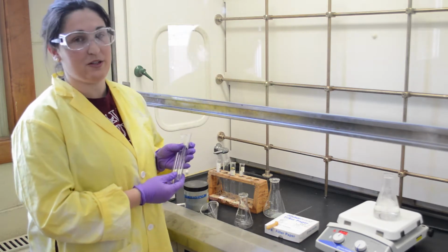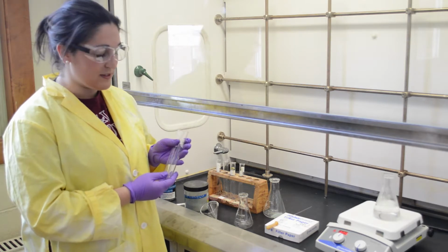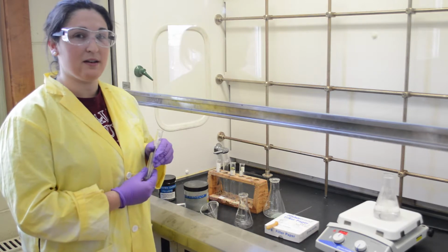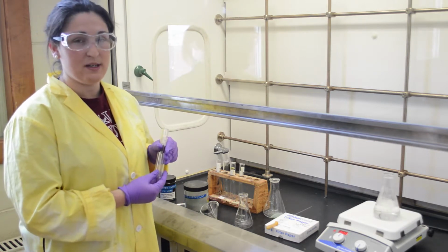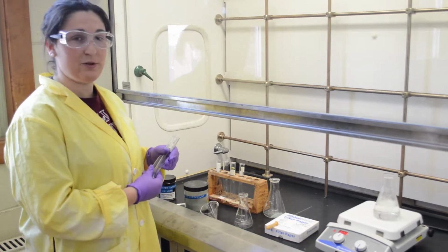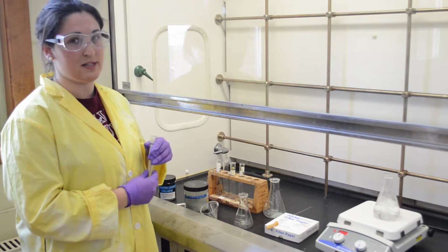Once you have done this, you can use the appropriate solvents and see which dissolves and which does not dissolve in the solvent. So for recrystallization, you want a solvent that can not fully dissolve it when it's cold, but instead fully dissolve it when it is at a hotter temperature. So once you have tested with a cold solvent, you determine which does not dissolve it and take those out.